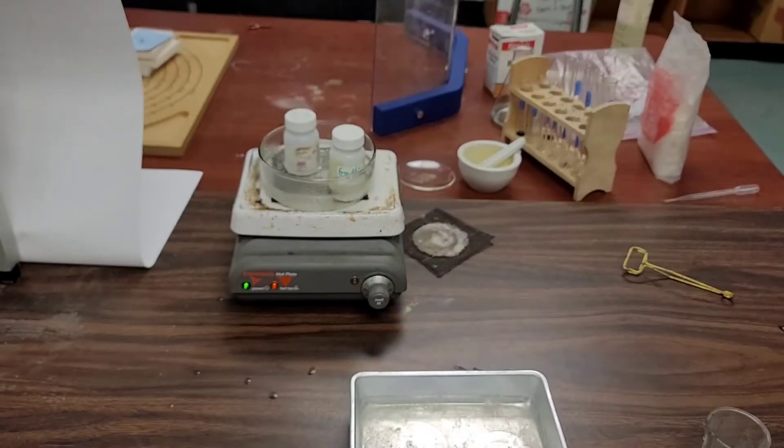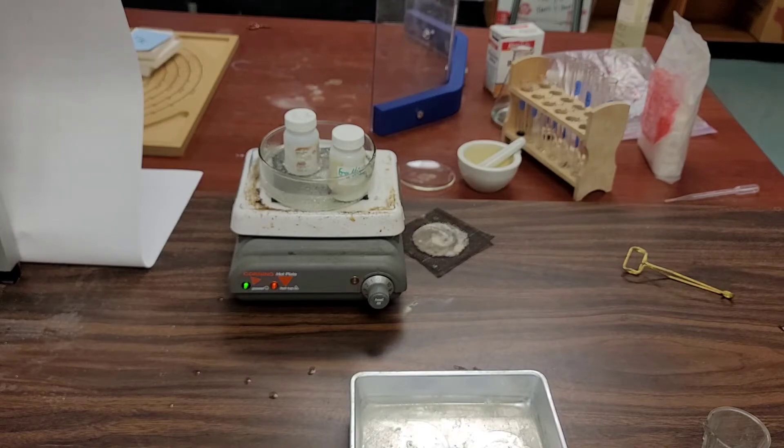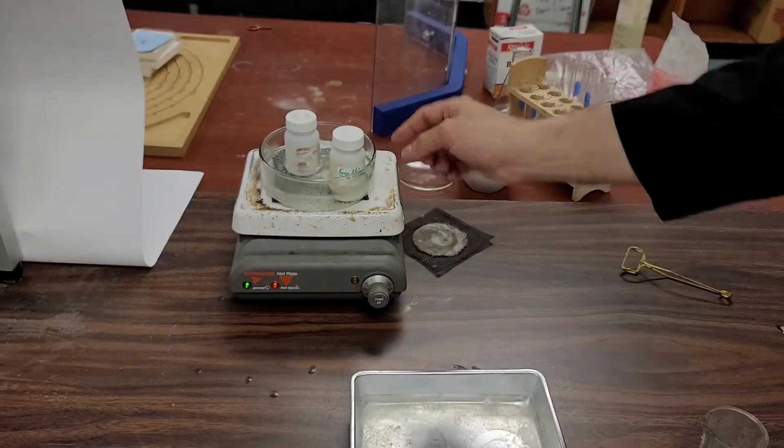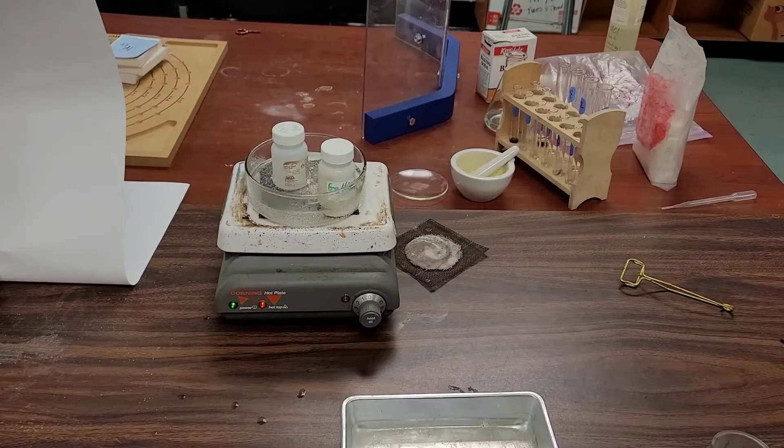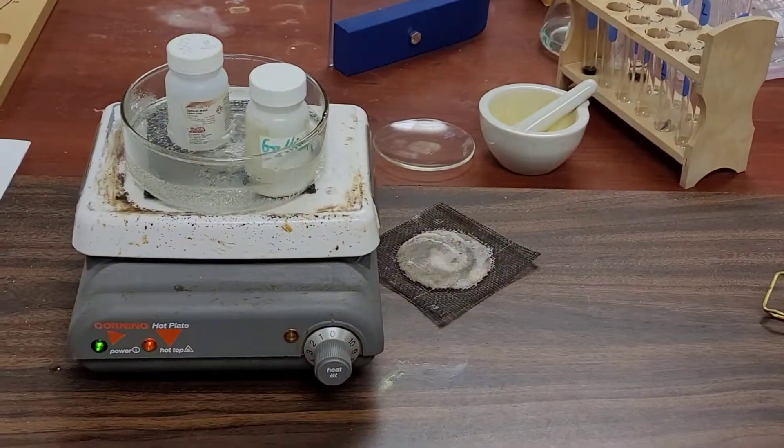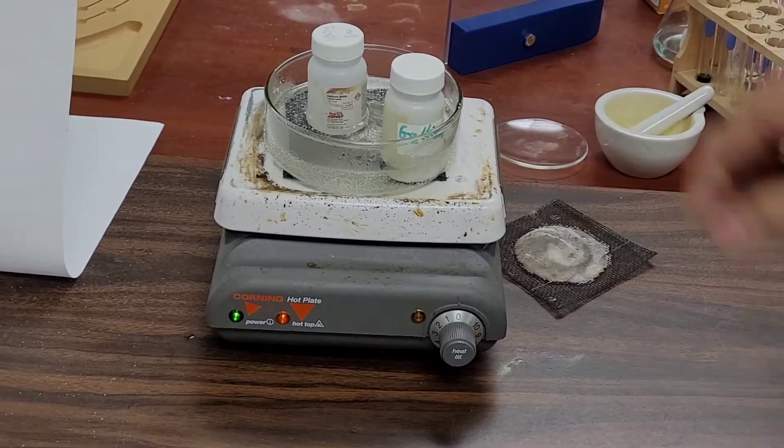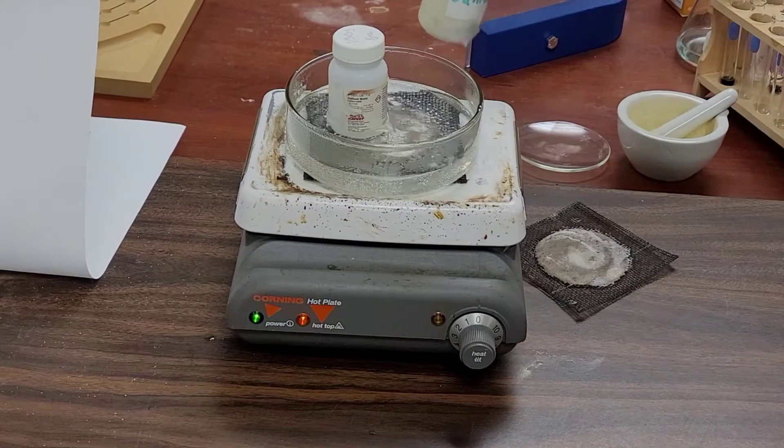All right, so now on to gallium. I don't know if you can see what's going on here, but the gallium is just in a hot water bath, so this is not like anything super hot, no flames.